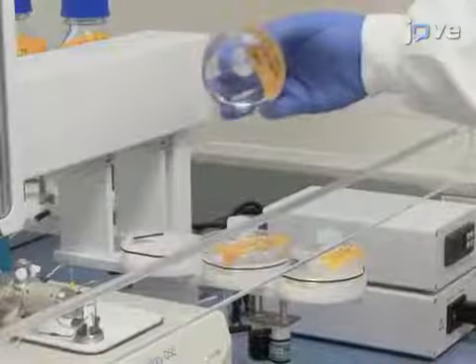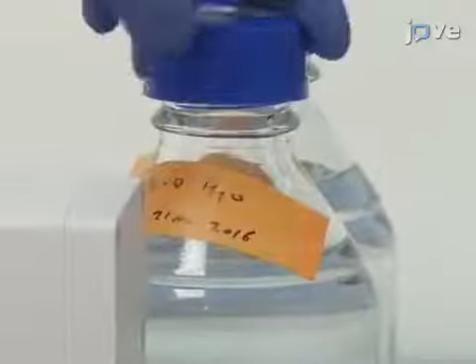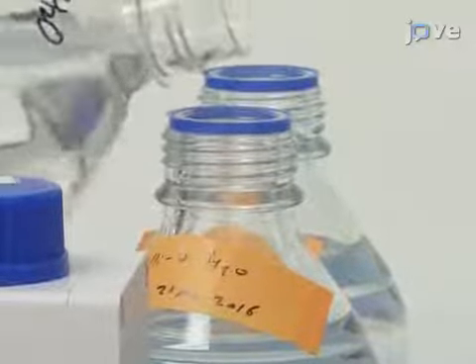Ensure that all the cleaning agent reservoirs are filled to the required volume. Required cleaning agents include detergent to wash the cell and water to clean the cell after each sample run.